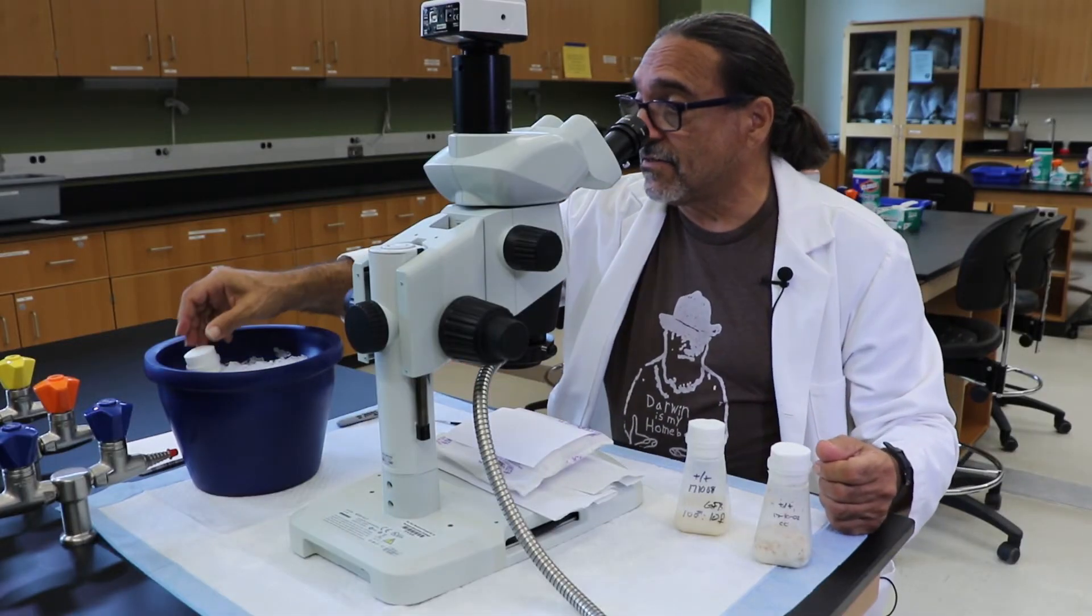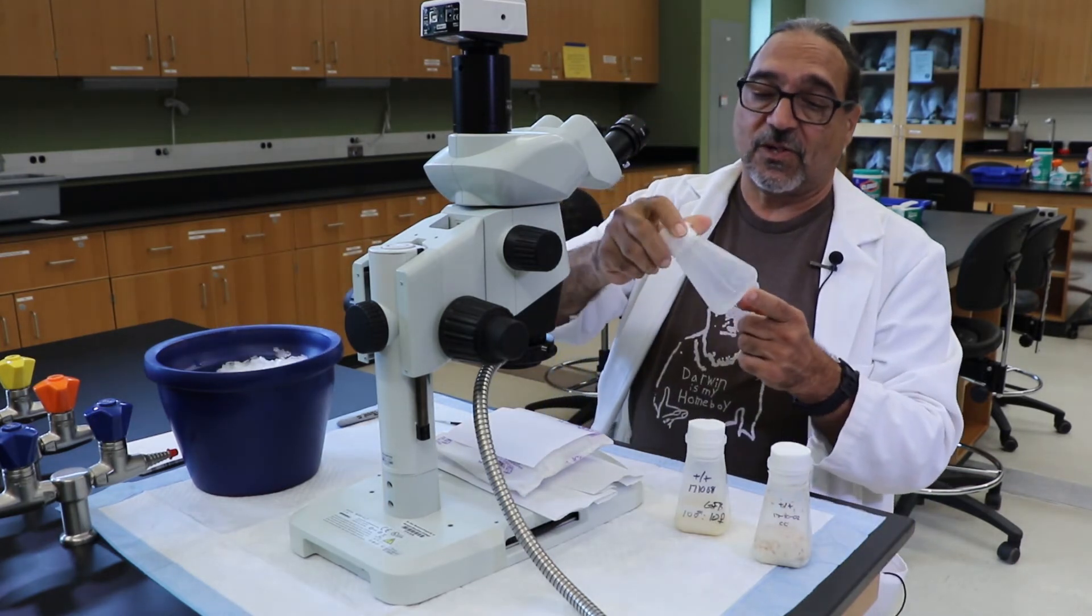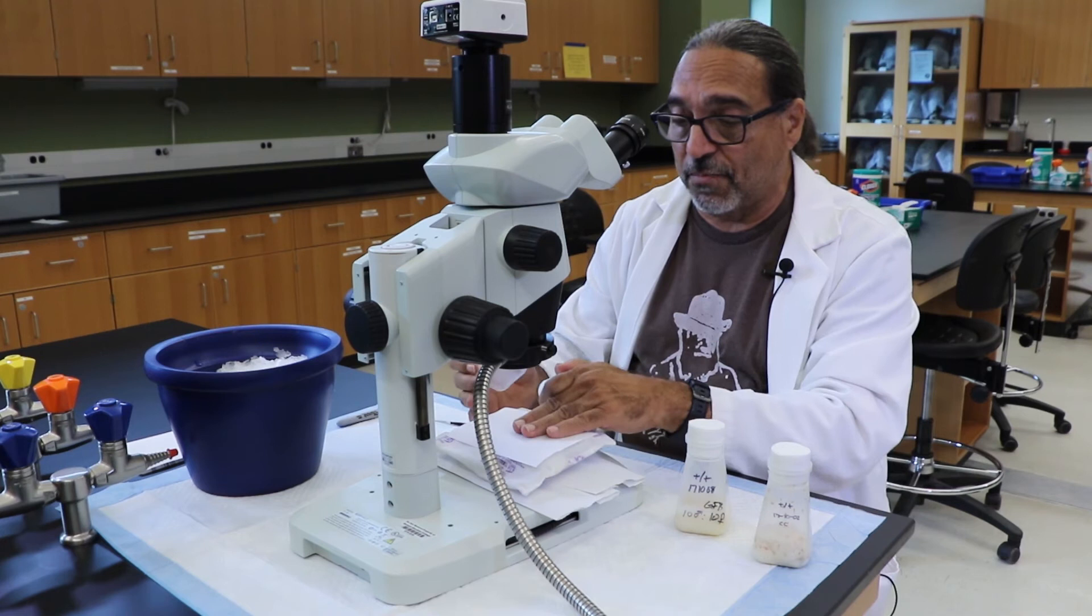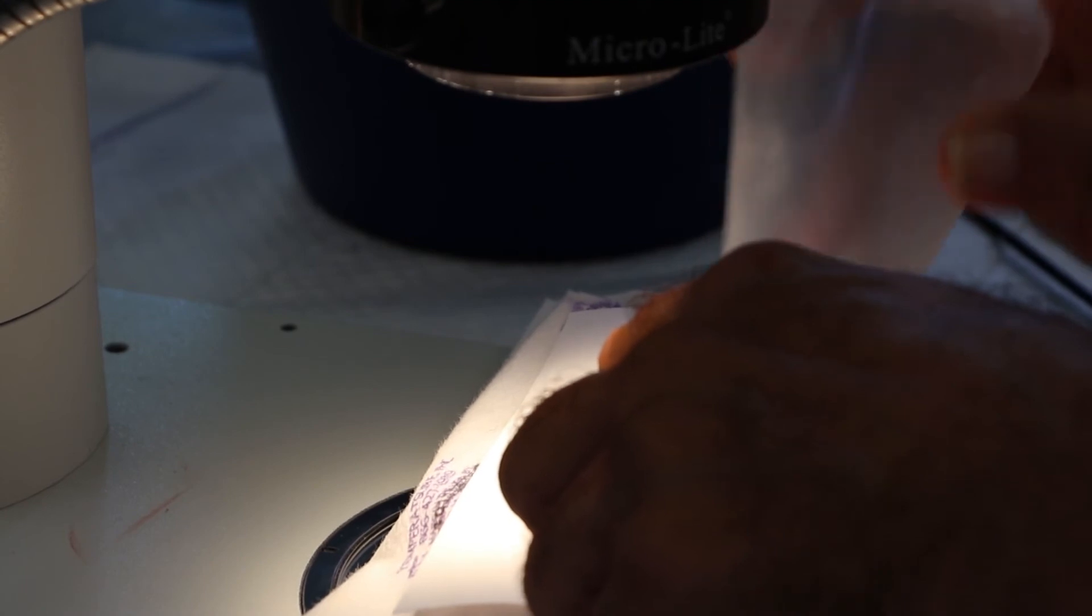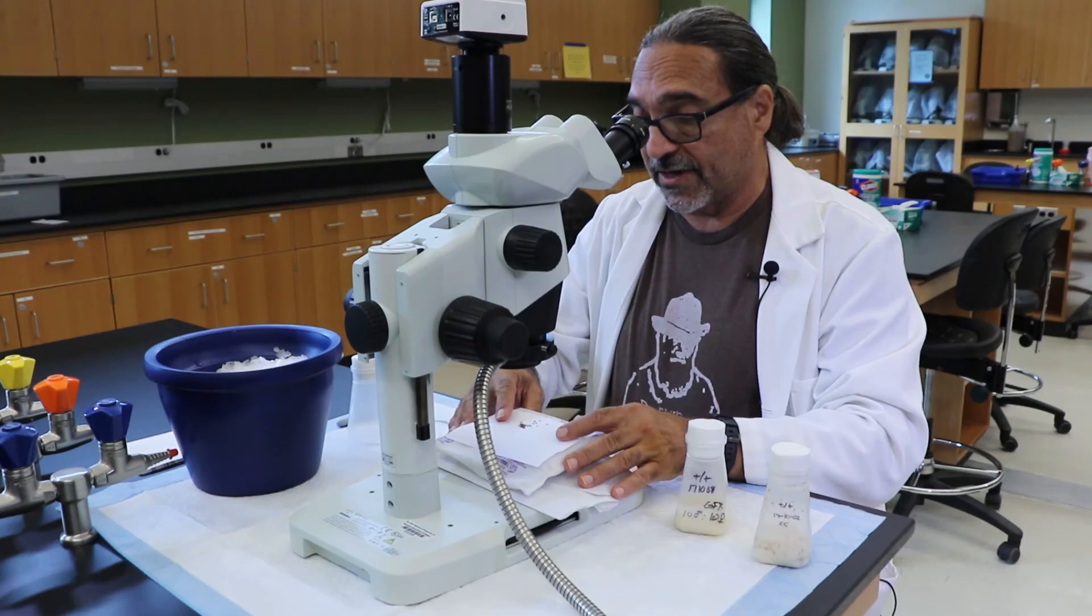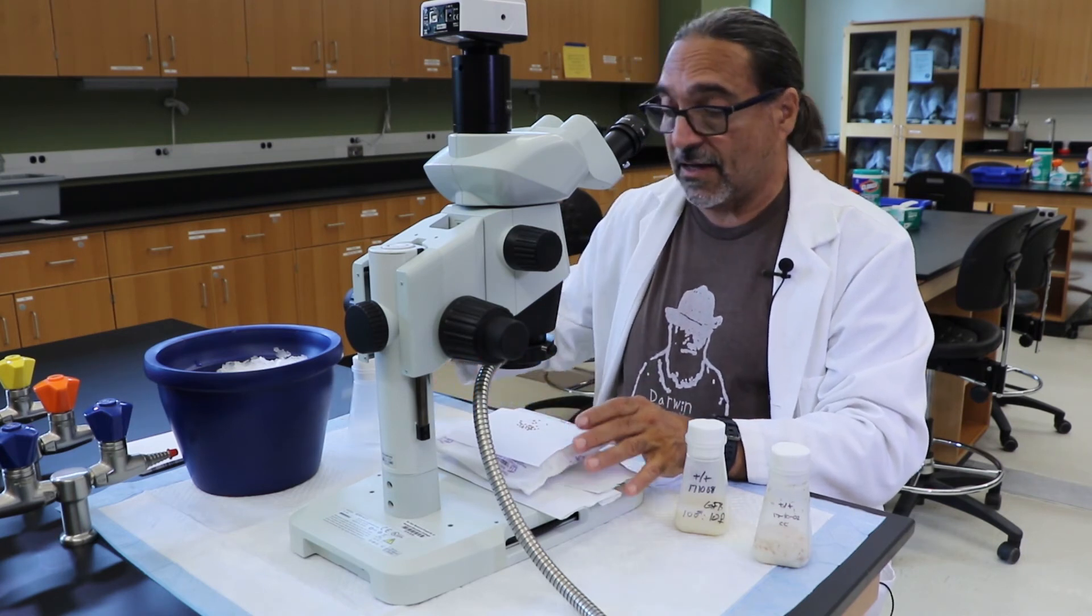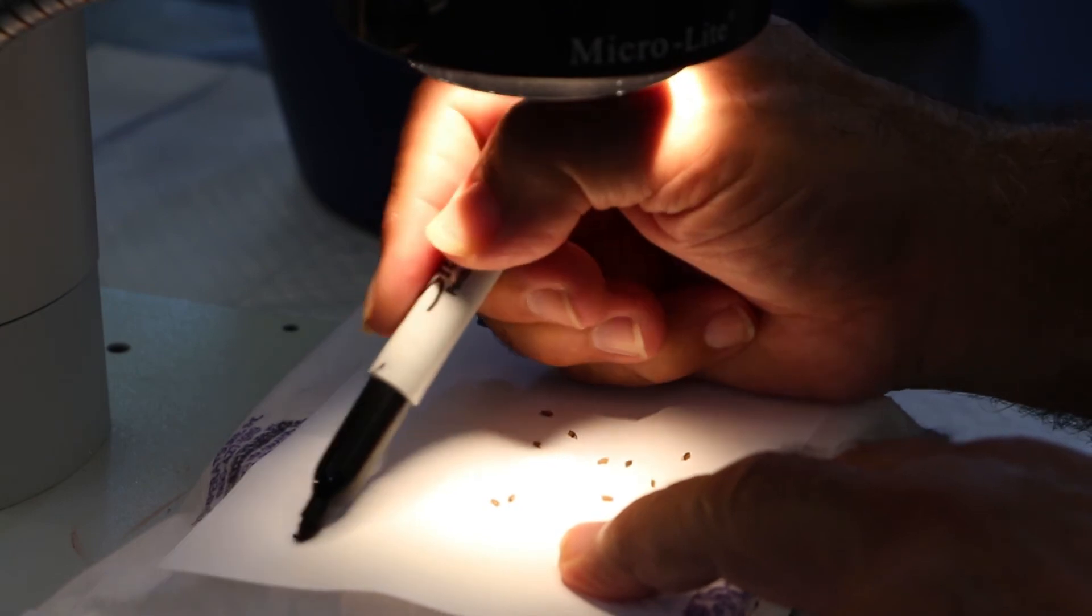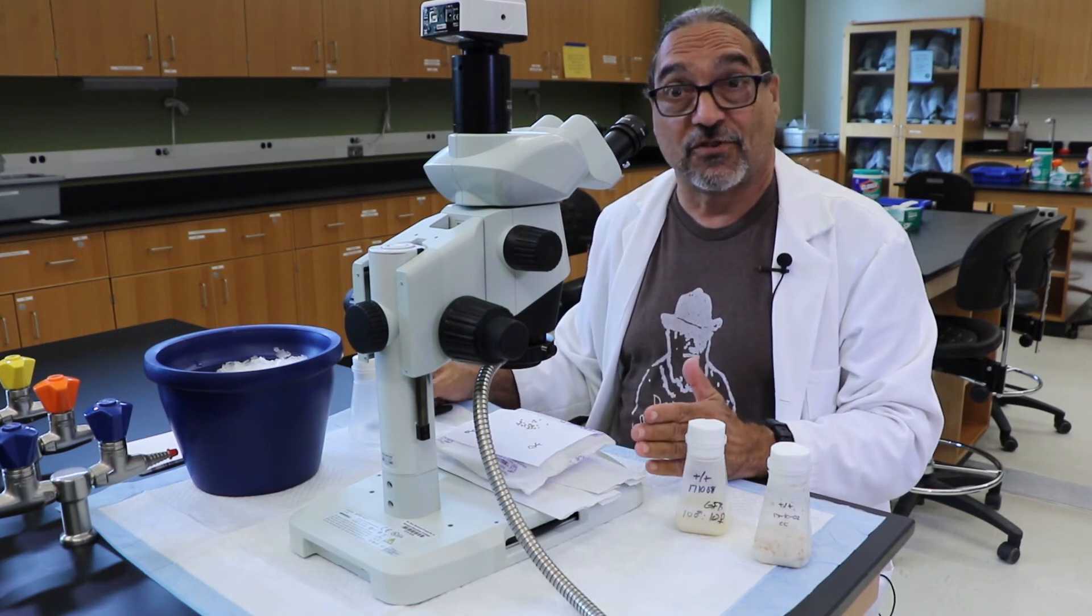After two minutes have passed, we can then take the transfer vial out of the ice, and while it's a little cloudy, all of the flies are asleep on the bottom of the vial. Now we're going to place them on the cold plate, and if you feel, the white paper is now quite cold, and we're just going to put the flies on the white paper. And now we're going to separate the flies by male and female. I always mark the paper with regard to position of males and females because, believe it or not, while you're working, sometimes you forget which side you push the flies to.